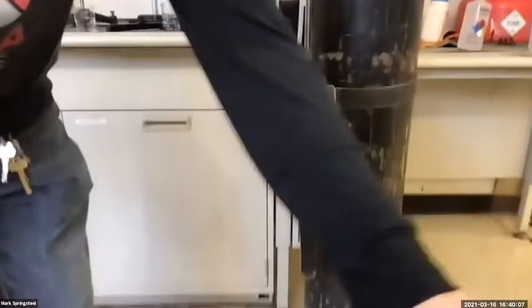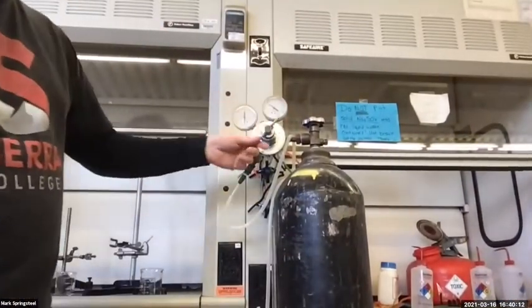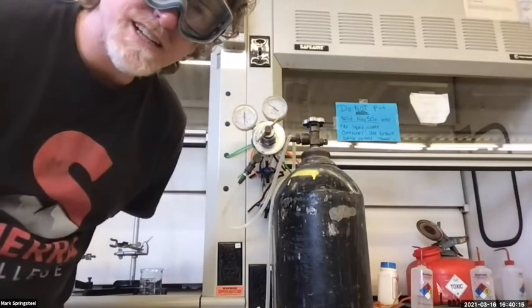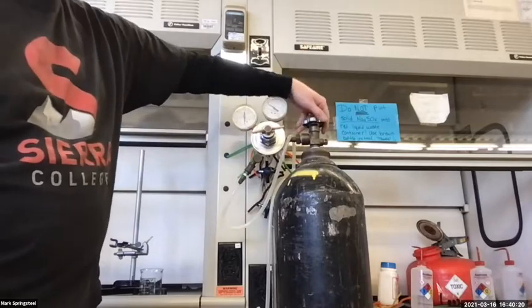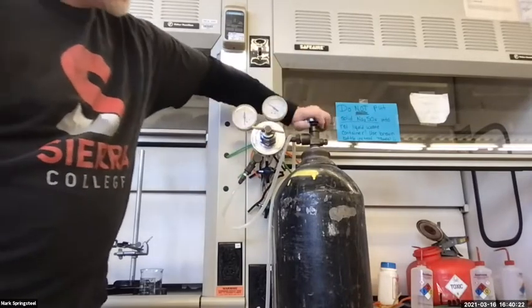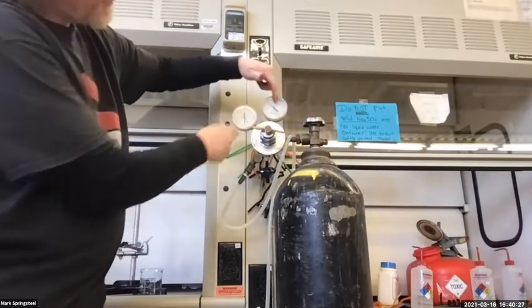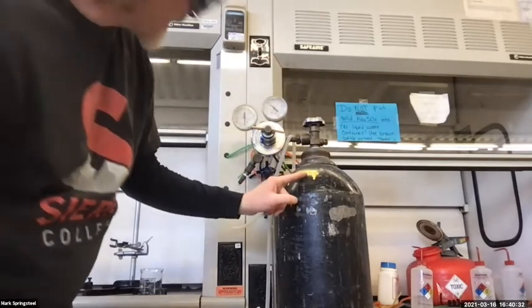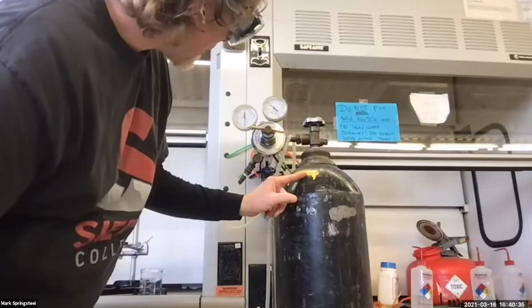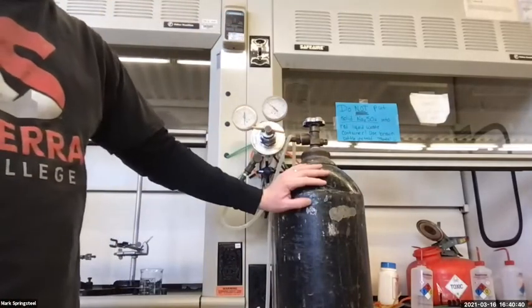Okay, here we go. So I'll bring you over to the nitrogen tank. And remember to turn on the nitrogen tank. I like to first make sure this is loose. Have I showed you the nitrogen tank? I think I did, right? Yeah, I'm pretty sure I did. I'll make this loose so I know that when I open the tank at the top, it's not letting anything out. Open the tank at the top, and this gauge, well, it'll go up a little bit. So this first gauge closest to the tank is telling me the pressure of gas in the tank. So currently I have about 8,000 kilopascals or 1,200 PSI of pressure, a lot of pressure of nitrogen gas.